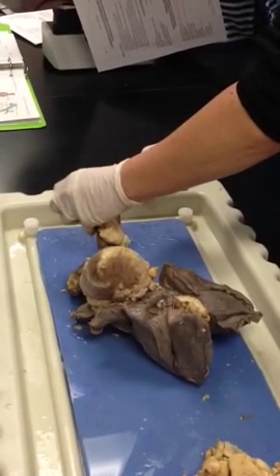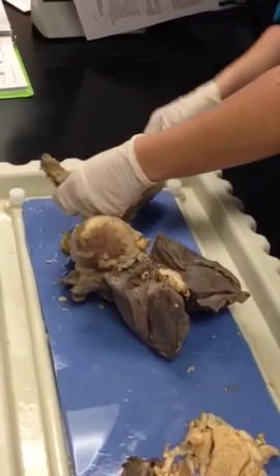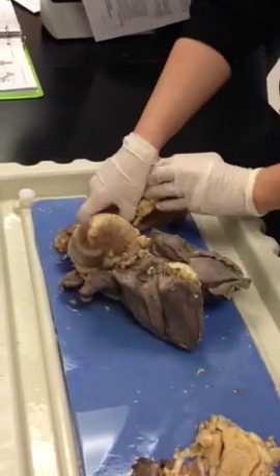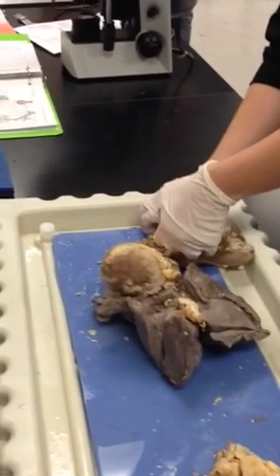So quiet. Can someone like talk or something? No, we just want to hear the fat cutting off. Could be that. What's that?